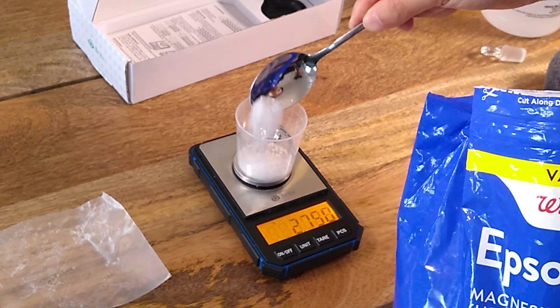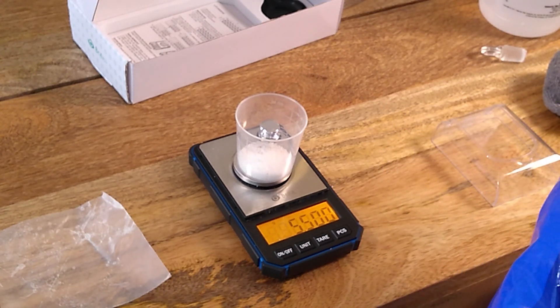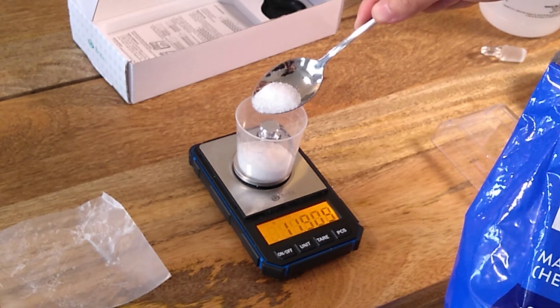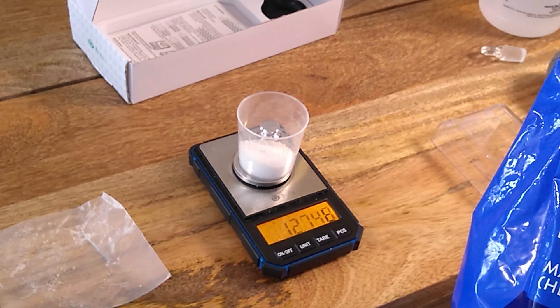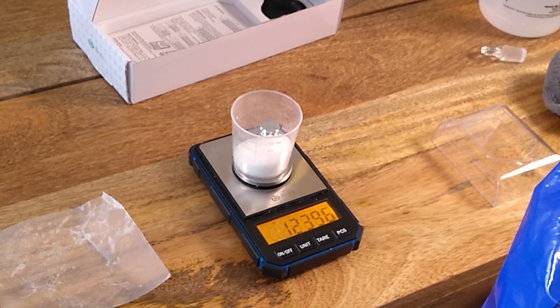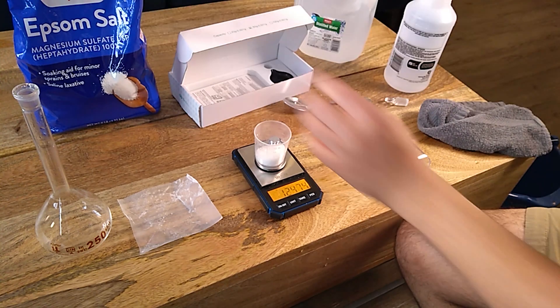Just adding it slowly. This cakes a little bit so you need to break it up. Now 13 — I went a little bit over. Okay, so 12.474 grams, which is accurate enough. We'll know exactly how much we added, which is exactly what we want.